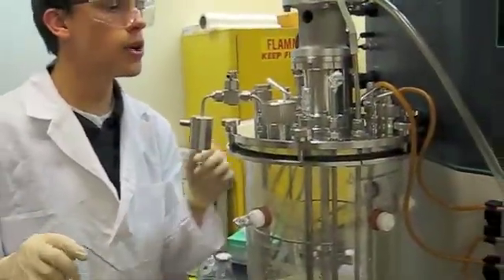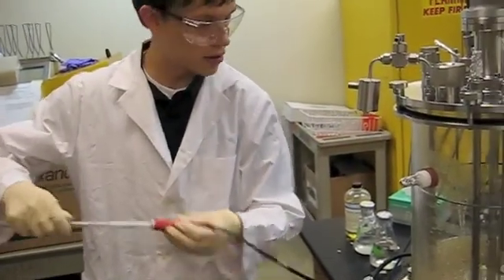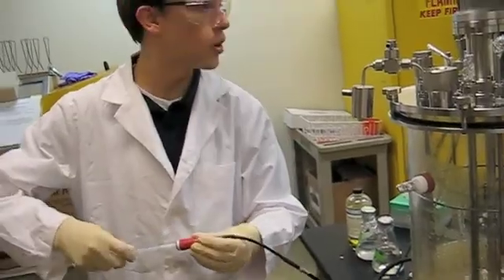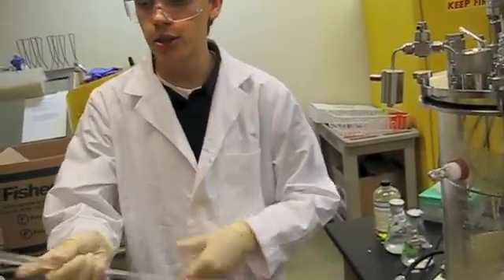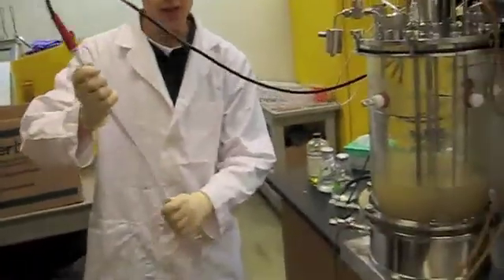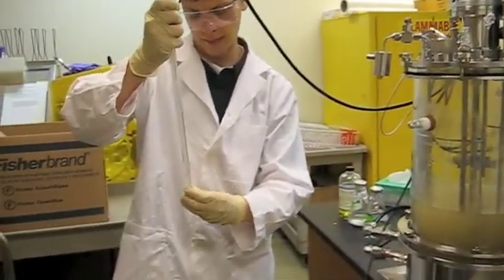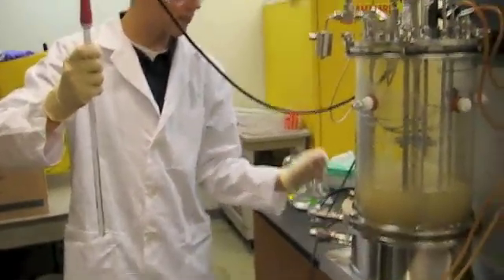While that's going, we are going to grab the thermometer and place it into the thermometer port. We are going to connect our pH probe. You screw it into the red outlet, which is connected to the pH port over here. Once that's screwed in, you're going to remove the electrolyte solution that it's stored in from the tip.